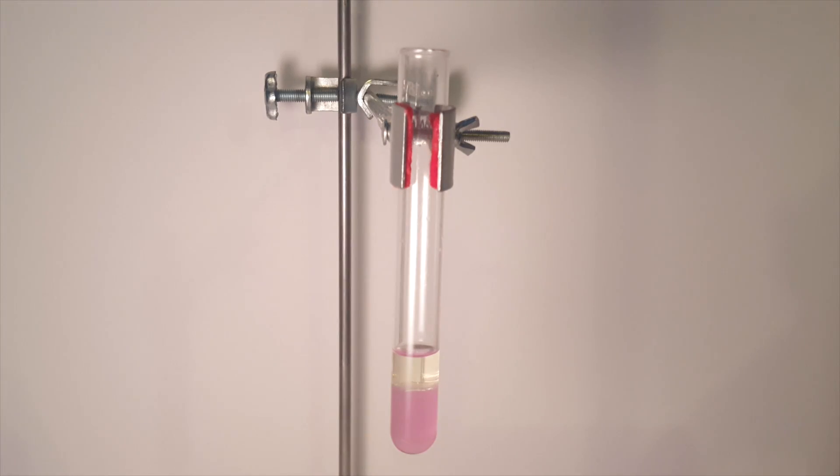I've never seen anyone repeat this experiment with potassium before, so I decided to give it a shot. You can see that the potassium melts into a sphere very quickly upon contact with water, and it bounces around much better than the sodium did. Because the mechanics of this reaction are essentially the same as the one with sodium, I included a close-up time lapse of the potassium here.